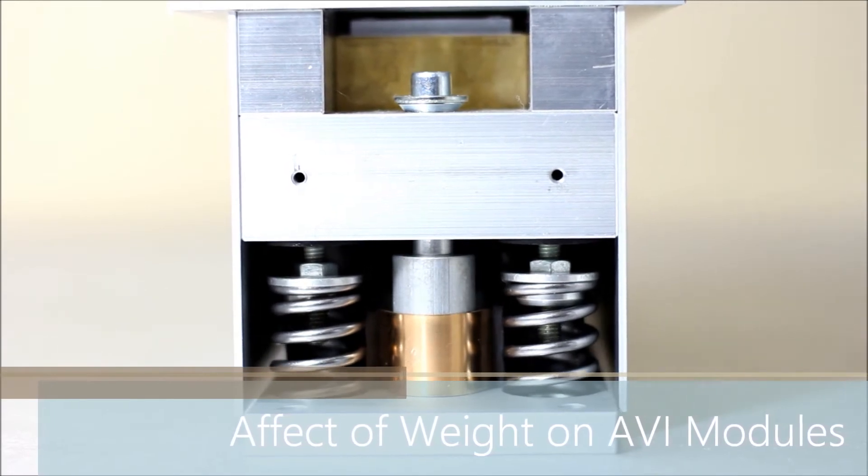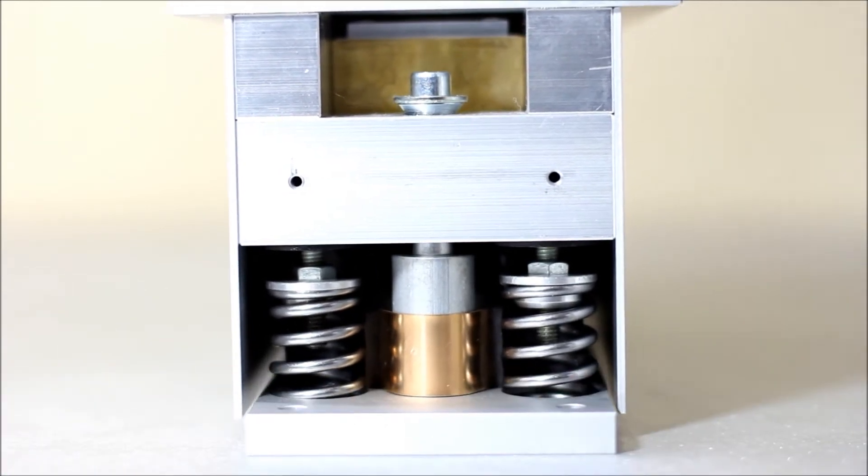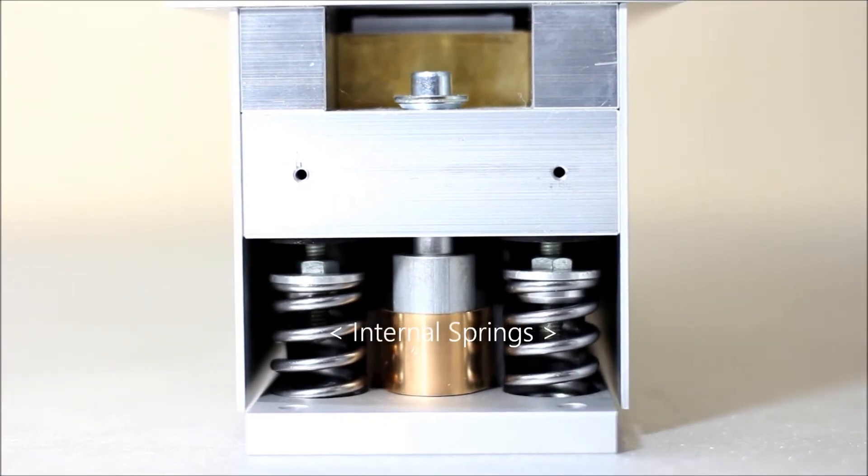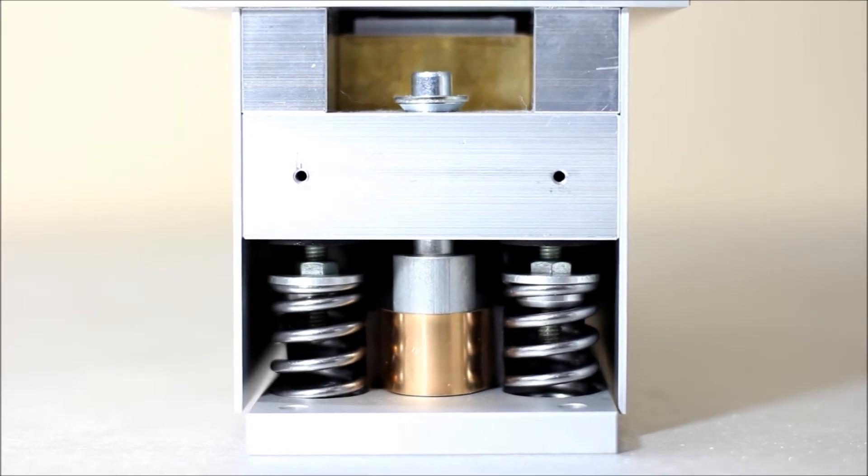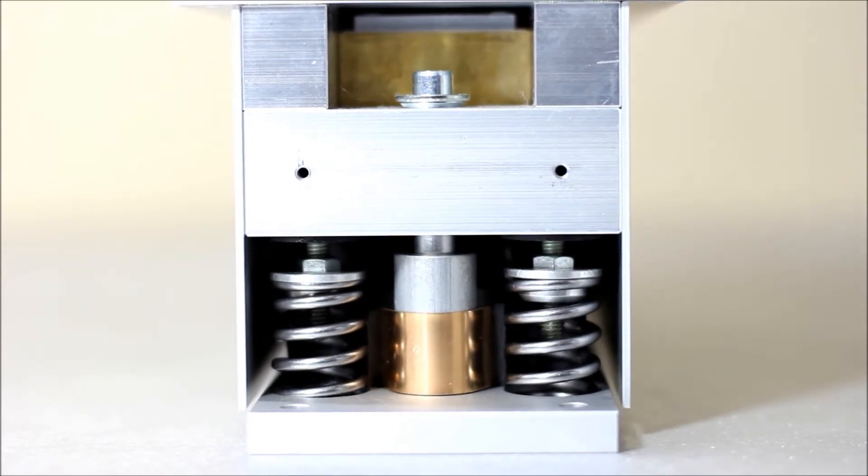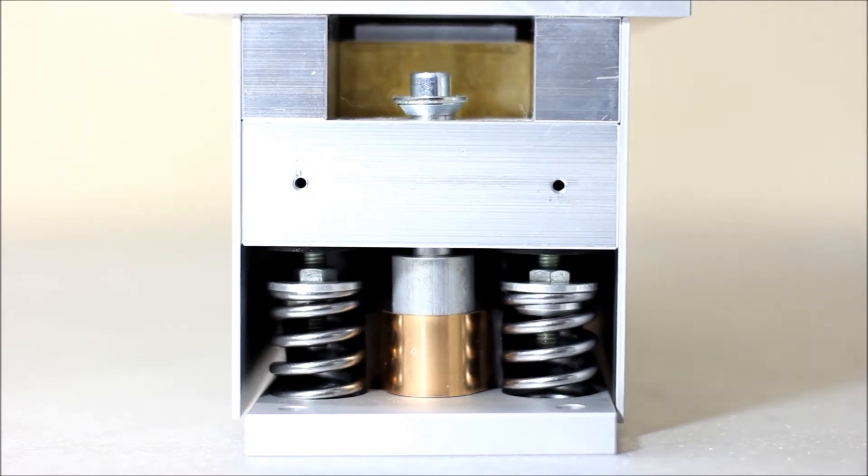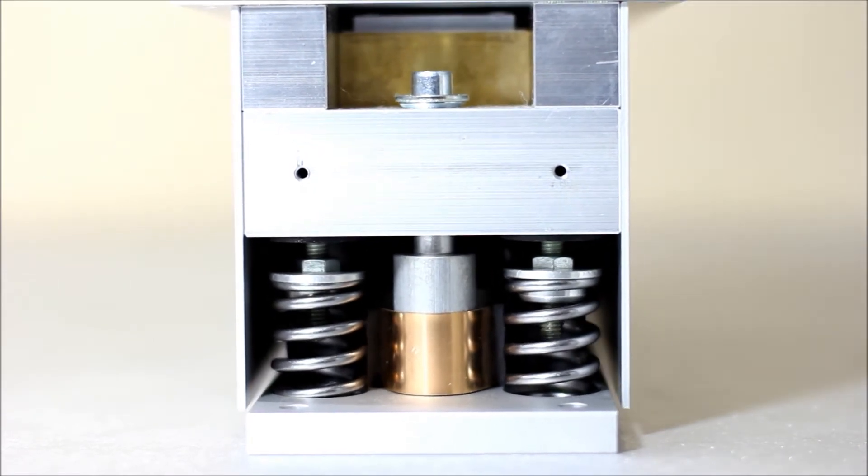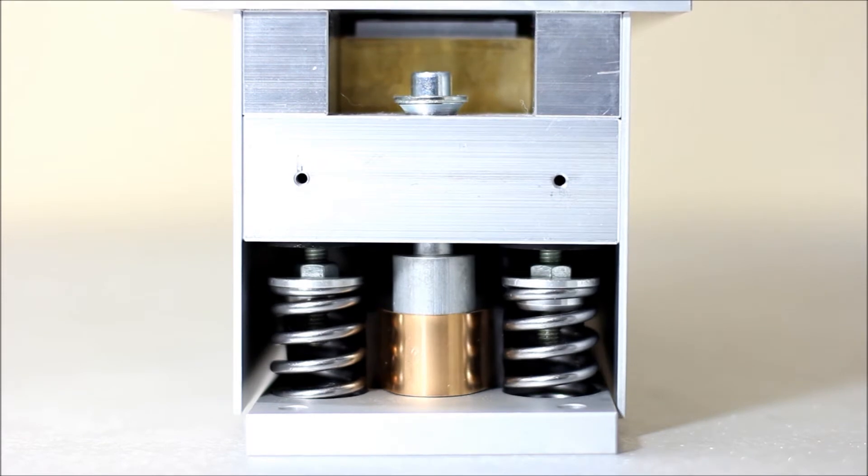Once the instrument has been positioned on the AVI series platform, the internal springs will work to compensate for the load. In order for the active vibration isolation technology within the AVI series to function correctly, the load bearing springs need to be adjusted to allow the AVI series to float the instrument.